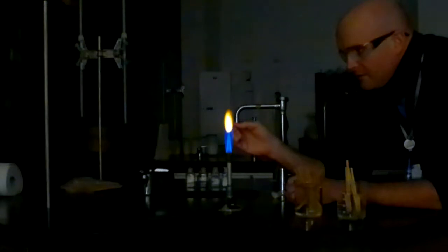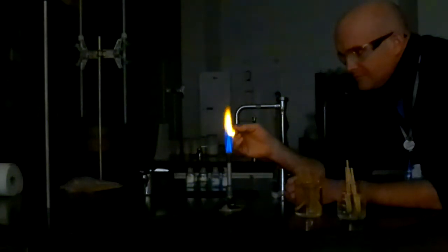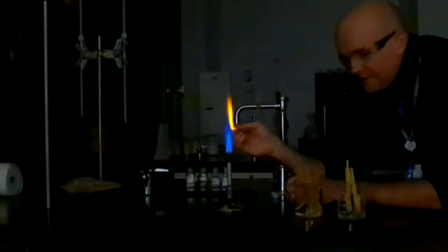Granular. Ooh. Very nice. And it's starting to go orange. That's because I'm burning the splint. So originally I think it was yellow, a yellow-orange. And then it went straight orange whenever I ran out of barium. Okay. And the next one is sodium chloride.